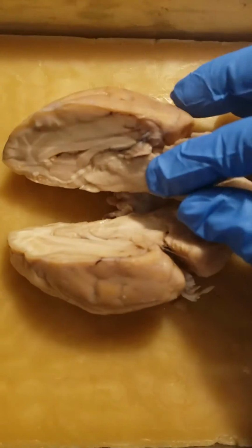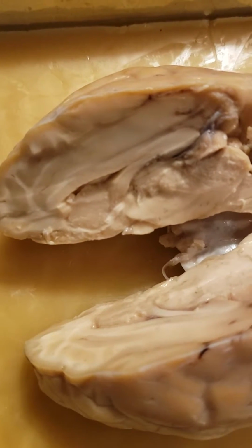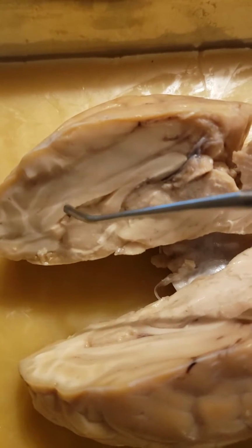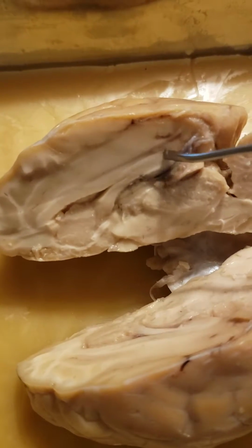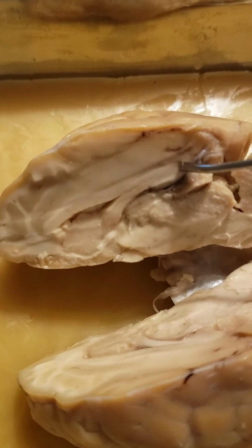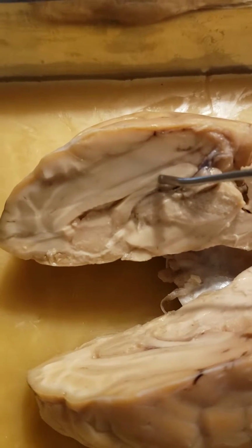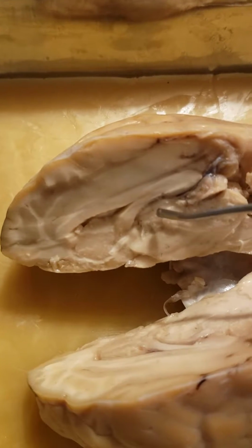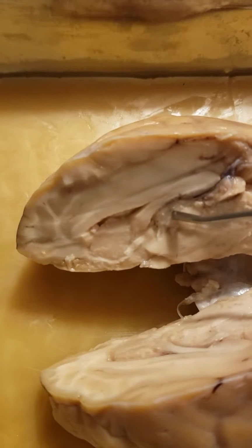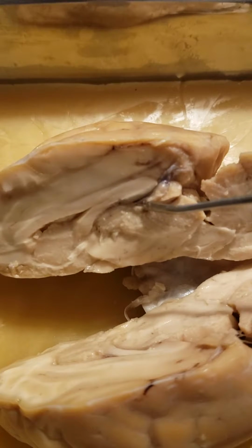And then open it up. So I've already cut it. Then right here, I'm going to use this little tool instead. This here, the top half of this, from here all the way up, is the corpus callosum, and that goes all the way down. And then the underside here is the fornix. And then from this little circular area here is the thalamus. And hopefully I use the right side. Yes, so right here, this is the pineal gland.